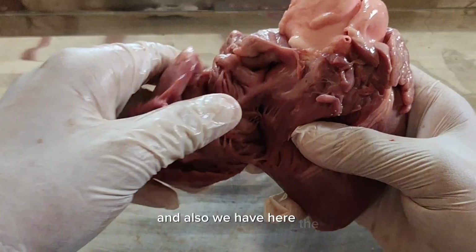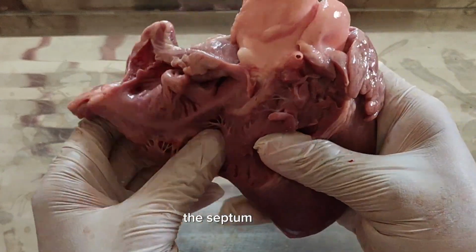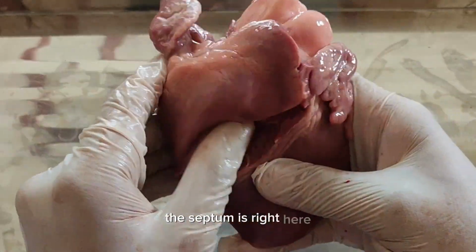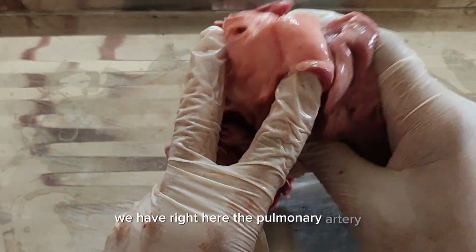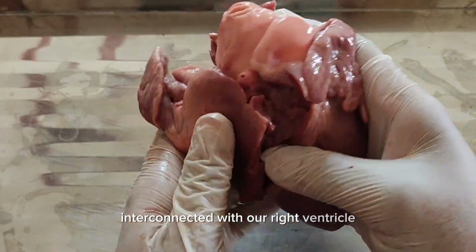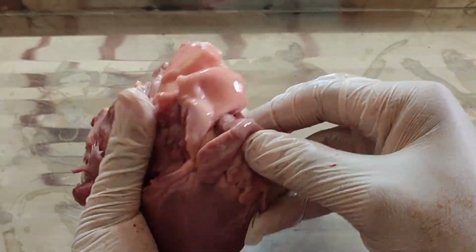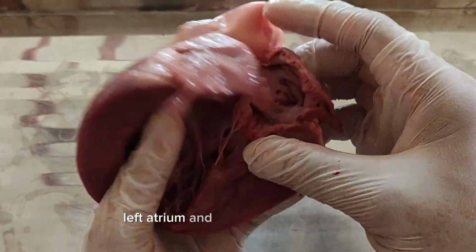And also we have here the septum, which separates the right and left pumping ventricles from each other. The septum is right here. And the pulmonary artery we have right here, which is interconnected with our right ventricle. And then in here, in the left side of the heart, we have the left atrium and the left ventricle.